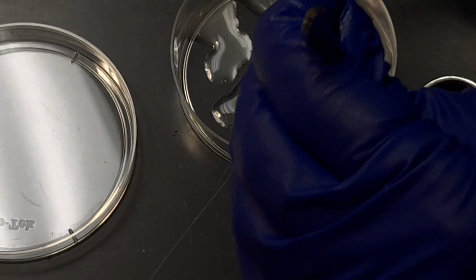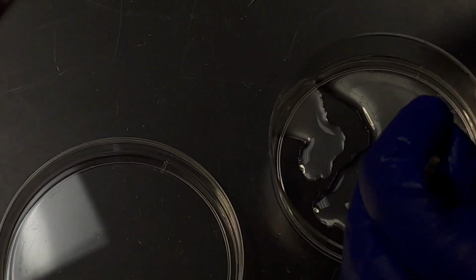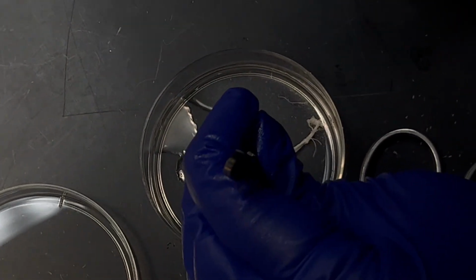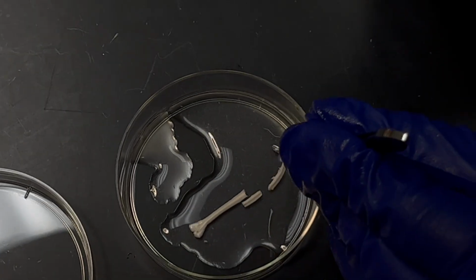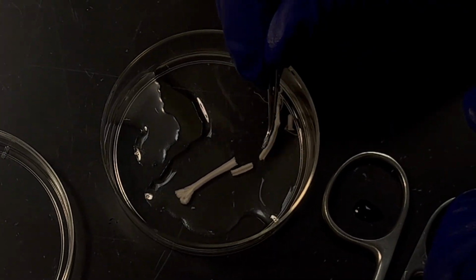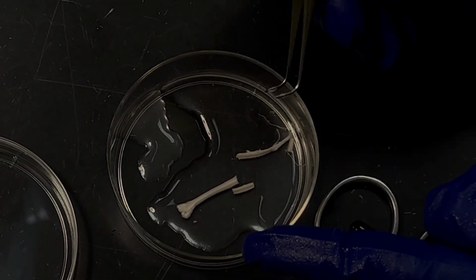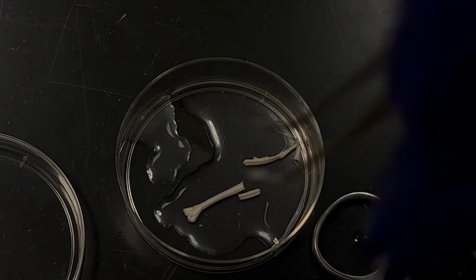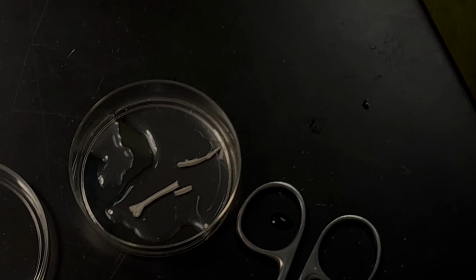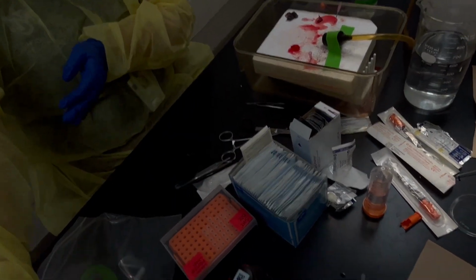Yes, but essentially what happened, Andrea, is this part was actually the lumbar spinal cord. So this was like this. And do you see how beautiful it is? If you can keep it intact, it's really easy to see where to cut. So you want to cut this side, and then you also want to cut this side if you're interested in only the dorsal. So this side when it's on the ice.